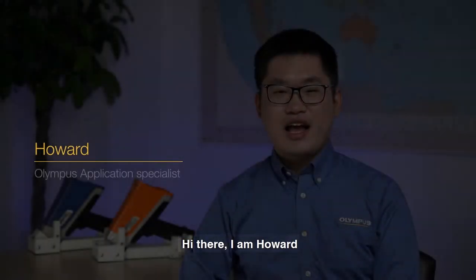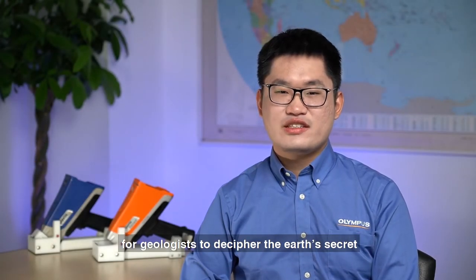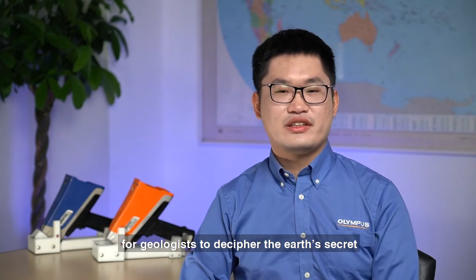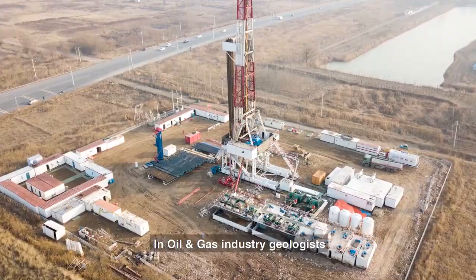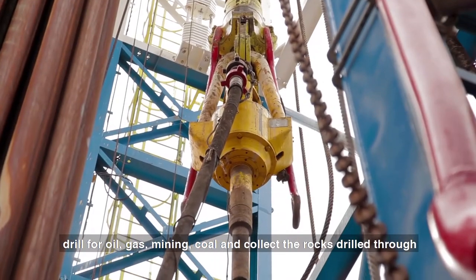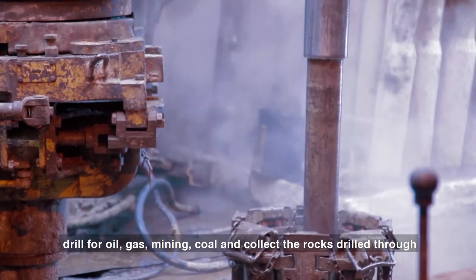Hi there, I'm Howard. Mud logging is an important matter for geologists to decipher the Earth's secrets. In the oil and gas industry, geologists drill for oil, gas, mining, and coal, and collect the rocks drilled through.